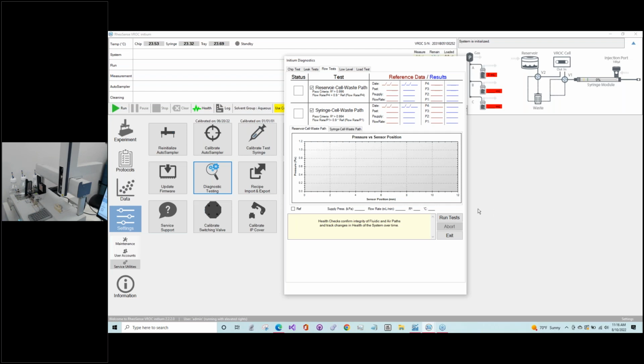And as Marina said, normally this is done automatically and you always do this after you press run, but we're doing it through the diagnostic testing so you can see what the outcome looks like.